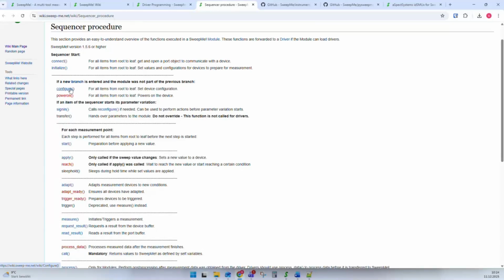Then there's a configure function. And this configure function is typically used to transfer the user input of the graphical user interface of the module to the instrument and set all these configurations. And it's very important not to do this in initialize, because if you use the driver multiple times in multiple modules in your sequencer, you don't want the second instance of the driver to override the configuration again. No, you want to write it exactly at the moment when you want to use the driver, and write the current configuration that has to be used.